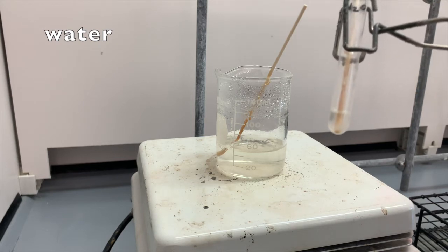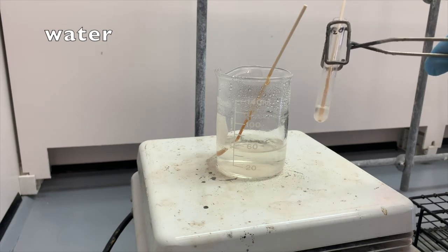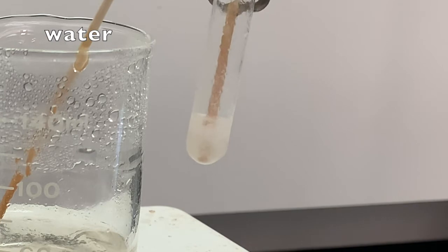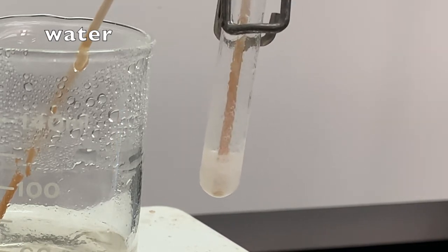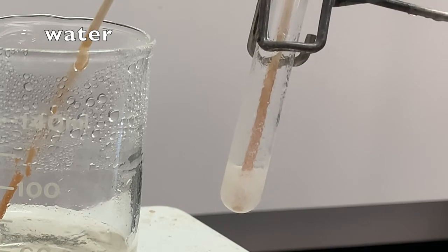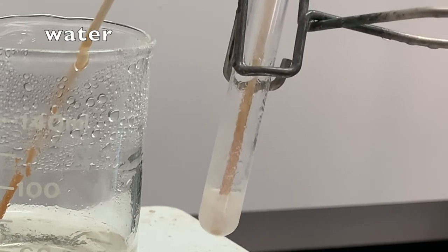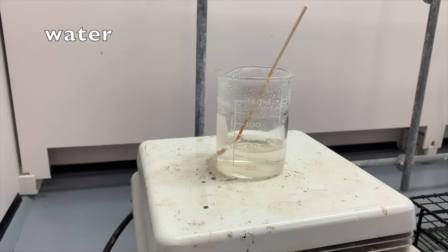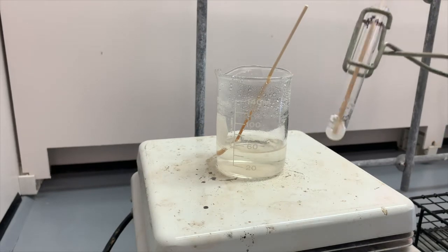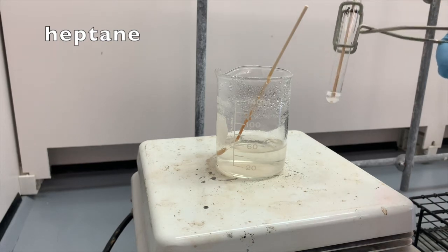And when I pull it out, it's definitely much more soluble than it was before, and it actually starts crystallizing immediately after taking it out of the warm water bath. So even at elevated temperature, as it hasn't reached room temperature yet and it's cooling, it crashes out of solution. Here we have a potential crystallization candidate. However, it does crystallize out of solution while the solution is still pretty warm. So we will put this in the maybe category. As we let it sit at room temperature, we will see presumably more material crash out. Now let's move on to our sample with heptane.